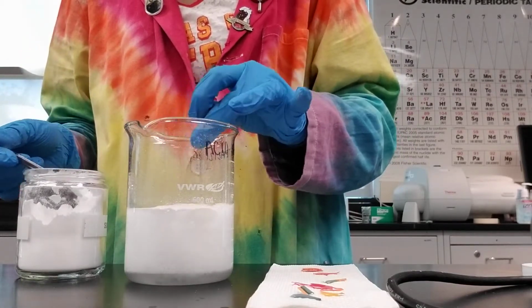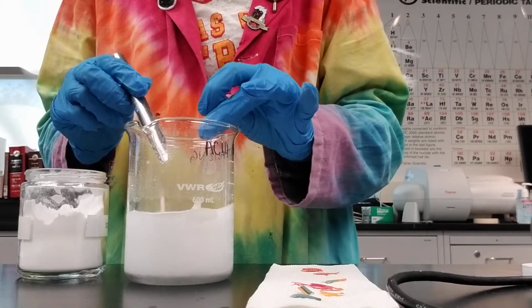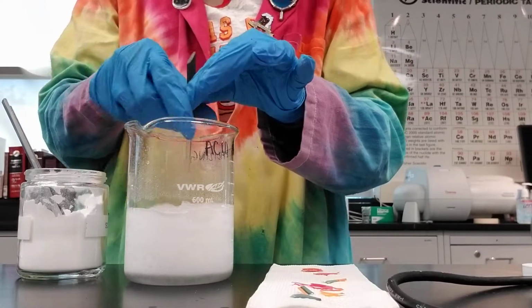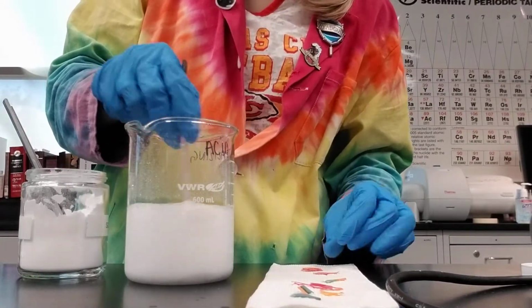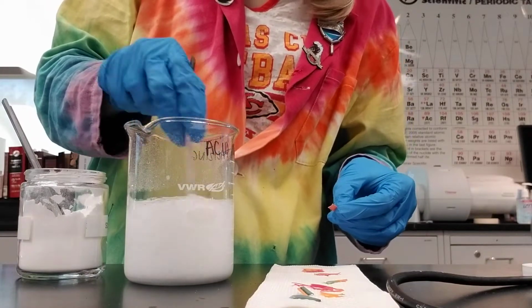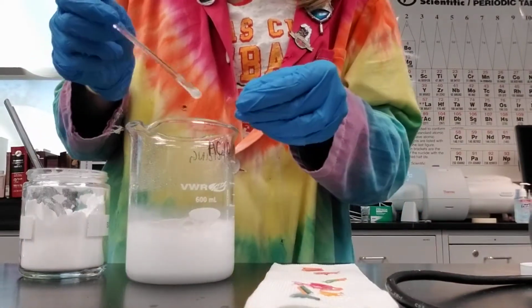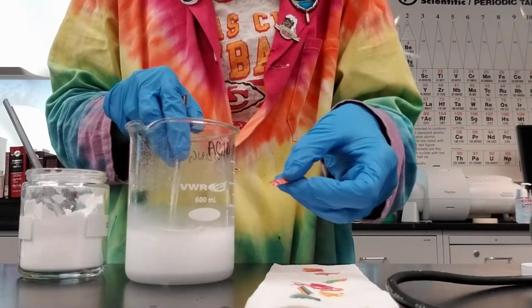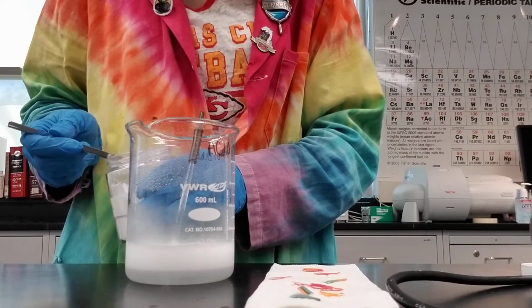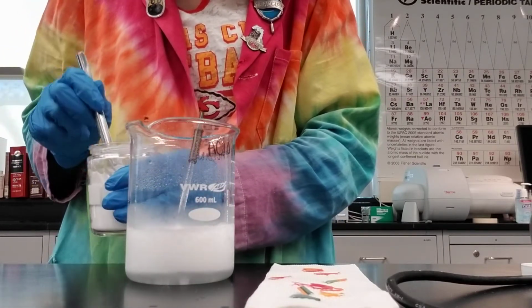That's why you don't want to fill up your beaker too high, or you need to add much slower than I'm doing. Okay, I'm going to stir this up real good, and I want to check the pH value again. It's still acidic, it's still very red, so I'm going to keep pouring and pouring. Well, to me, it seems to be slowing a little.